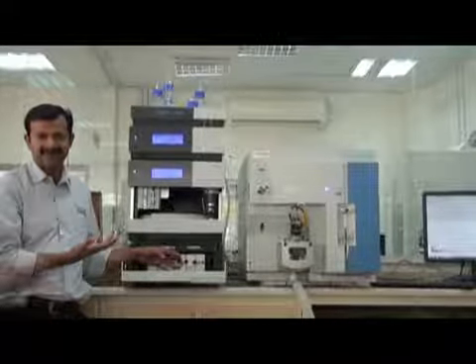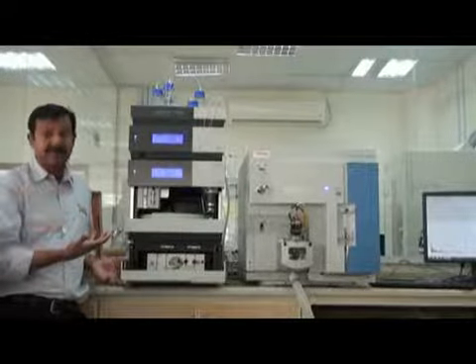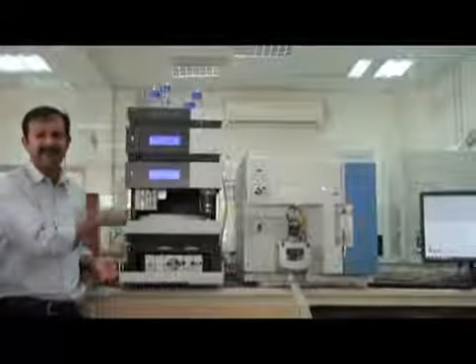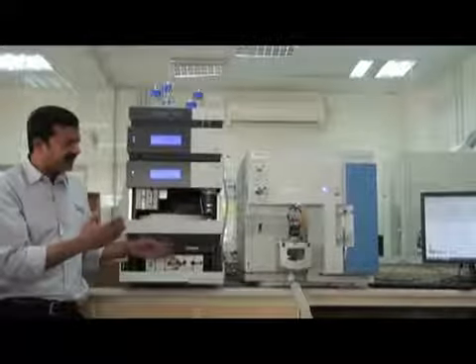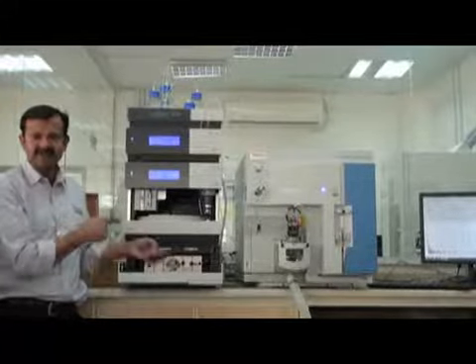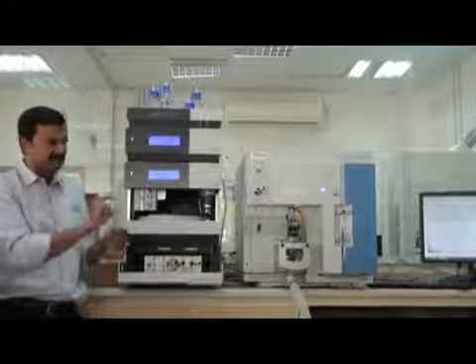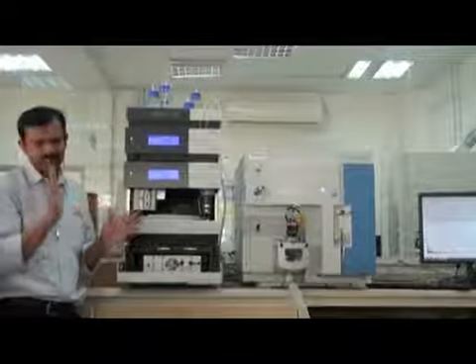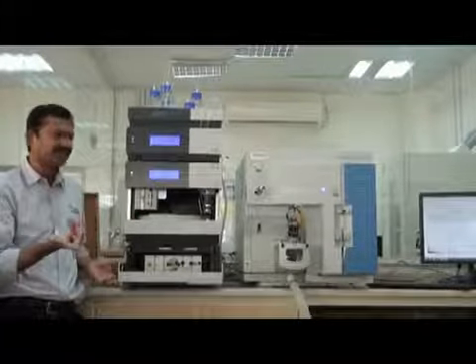Do we determine the life of the column by the pressure? By the pressure and by the cleanliness of the solvent. If you work at very high pressure, the life is decreased. Work under the pressure recommended by the manufacturer. Every column has written on it how much pressure you can work up to. So work within that pressure range, then there is no problem. If you go beyond that pressure range, it will obviously damage the column.